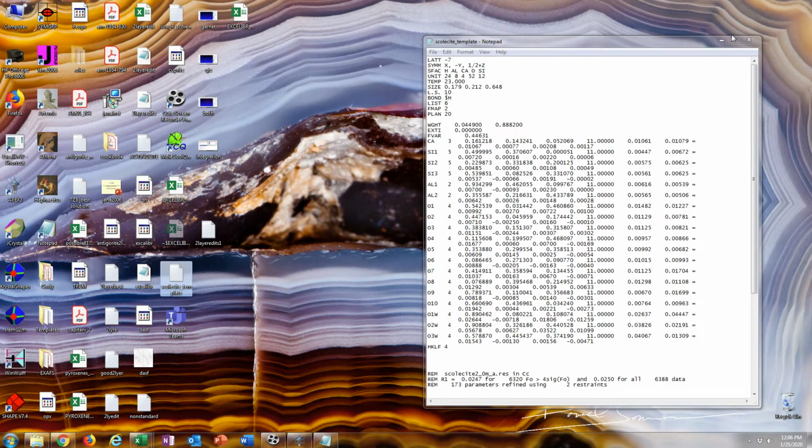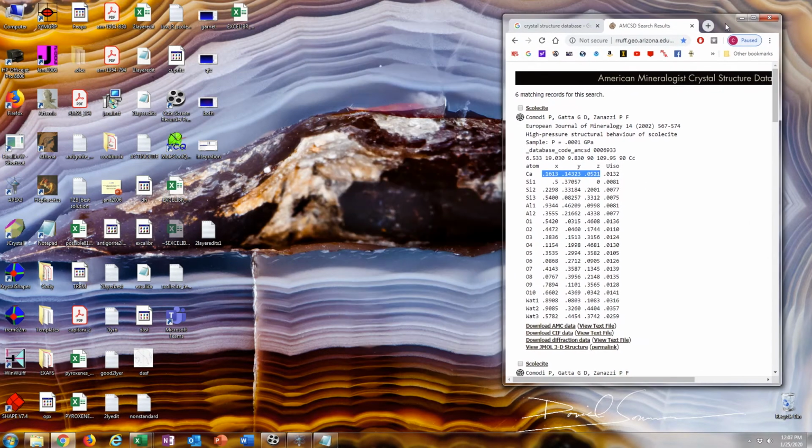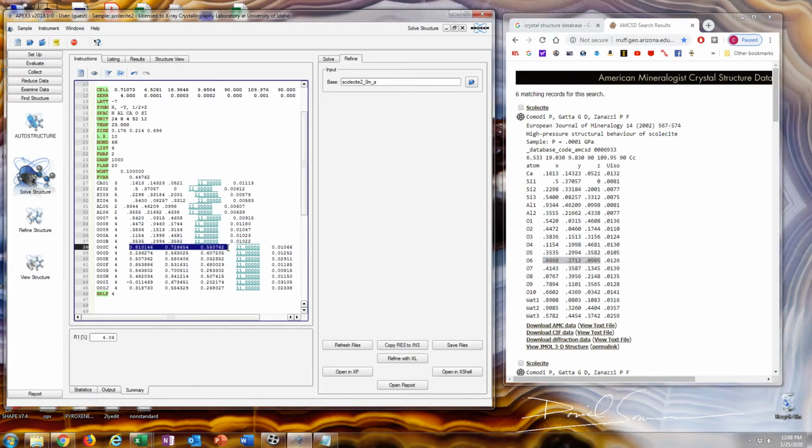So I'll just minimize that and open up their structure over here. What you have to do, if you use the right lattice and you want to put this in convention, you have to paste these fractional coordinates into each atom. So just copy and paste, and if I did pick the right lattice that corresponds, then this should have no problems. If it has problems, then you probably picked the wrong lattice. So I'm just going to fast forward through this. And okay.